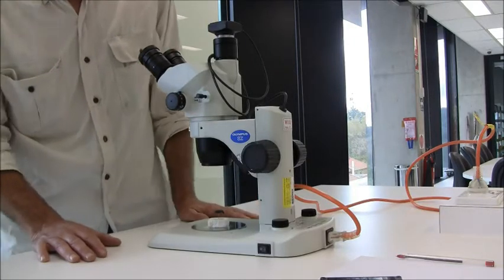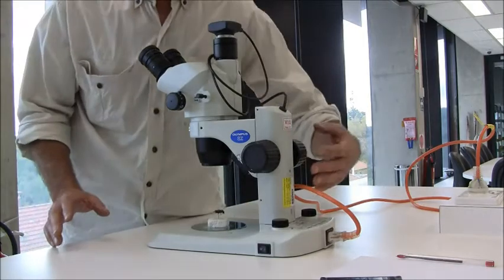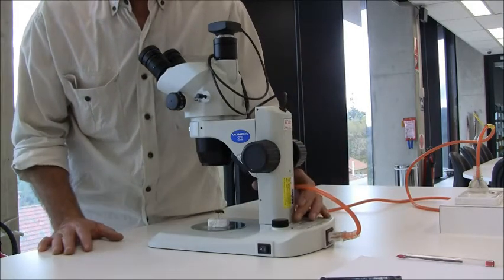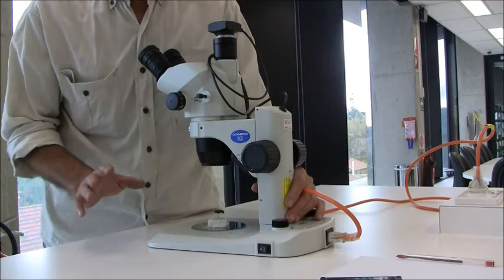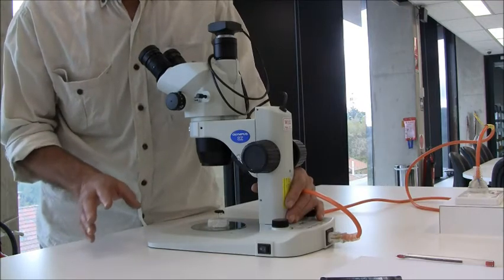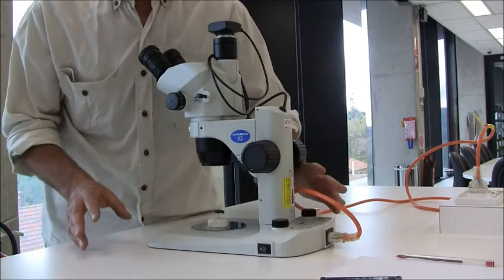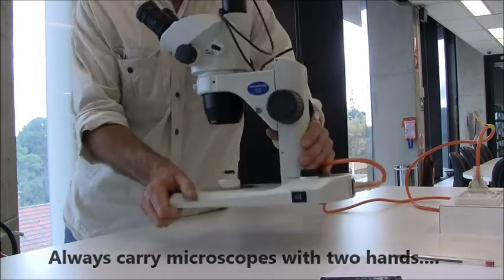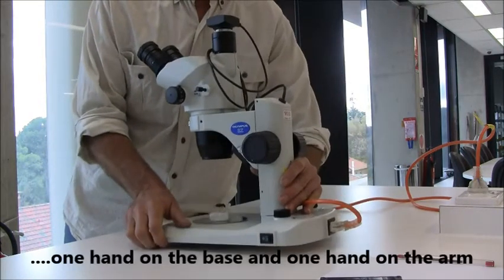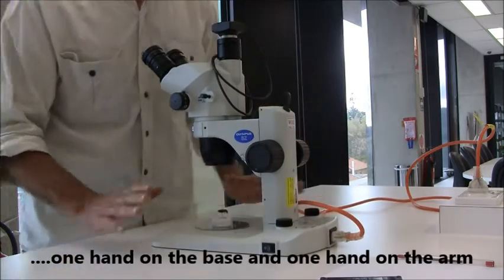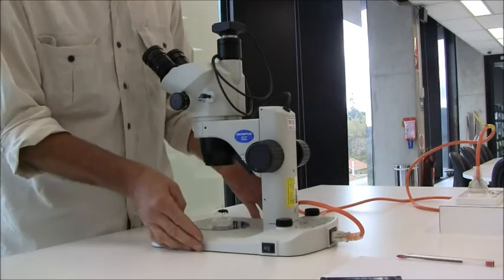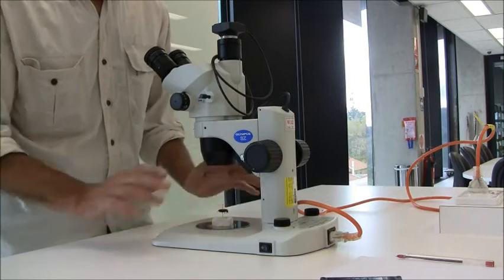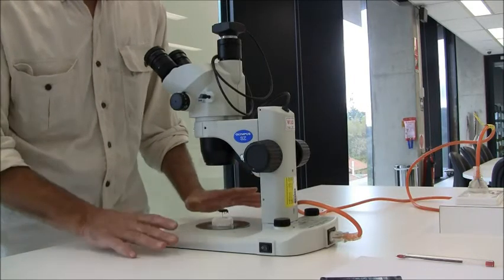Now setting this microscope up, I'll first mention how you carry them because they're quite expensive and if you drop them, they would certainly not come out the best. You would grab it by the post and by the base, a nice firm grip to manipulate the microscope. Once it's on the bench, you try to set it up where it's convenient and then pretty much leave it where it is. Pushing it around the bench is not good either.